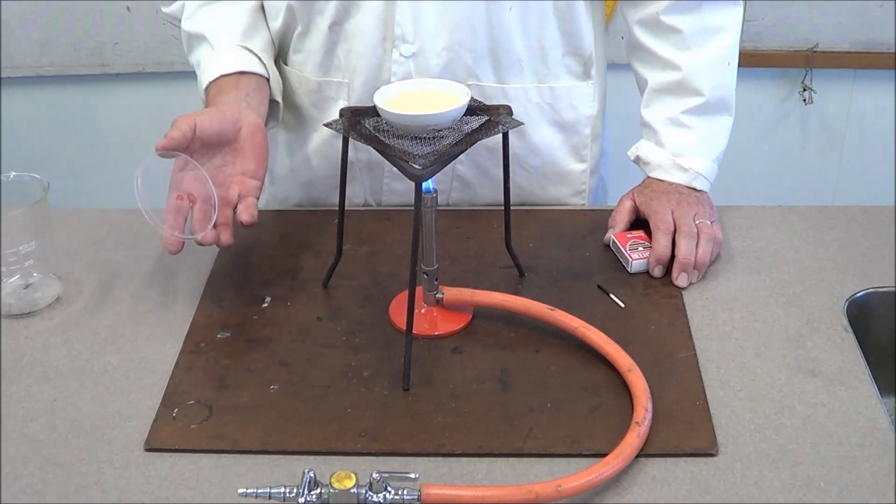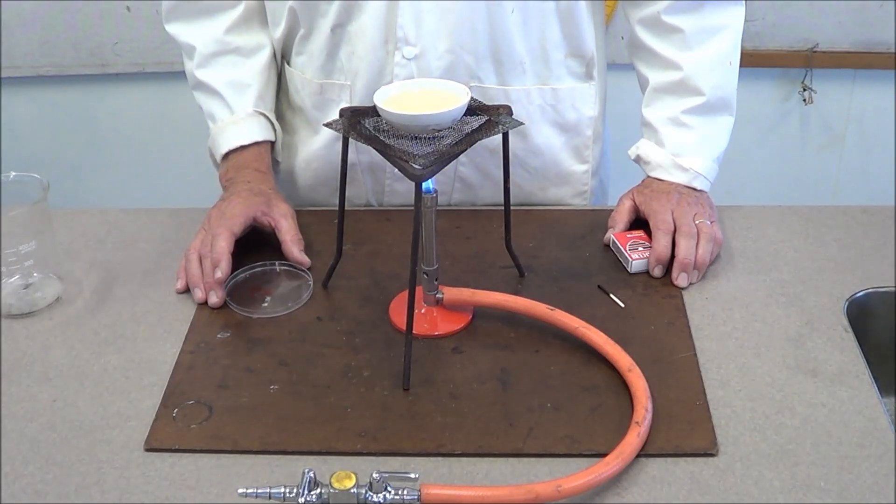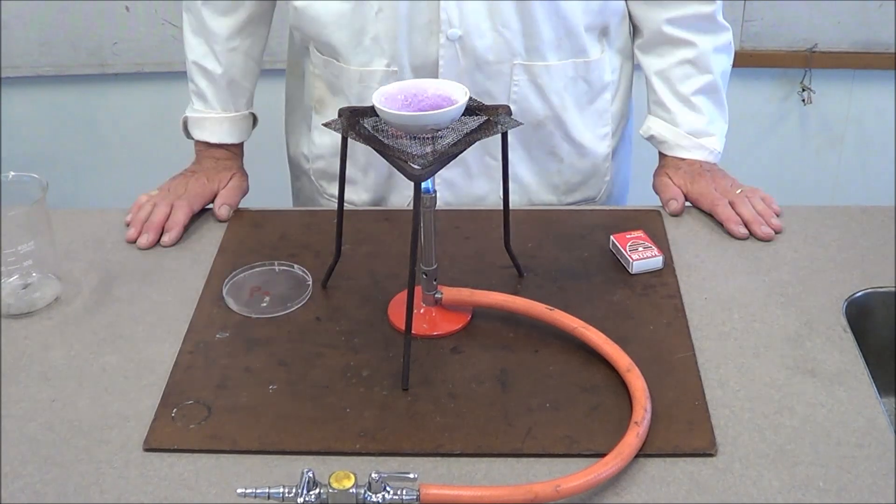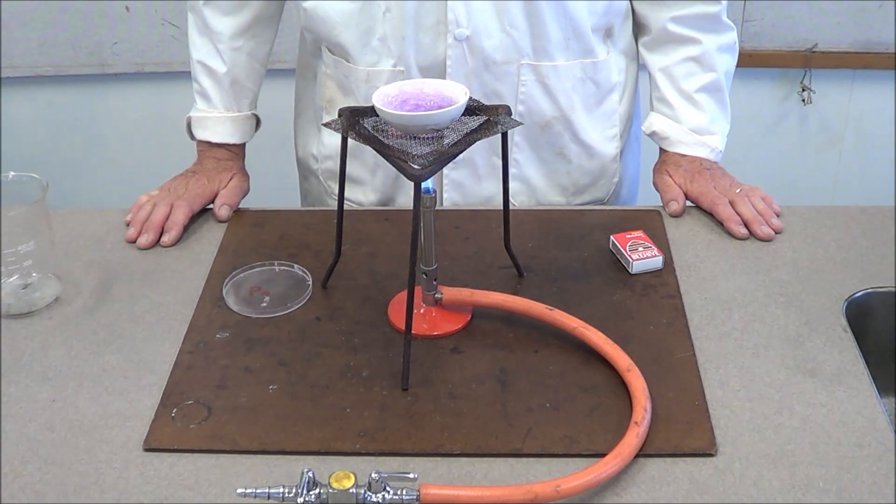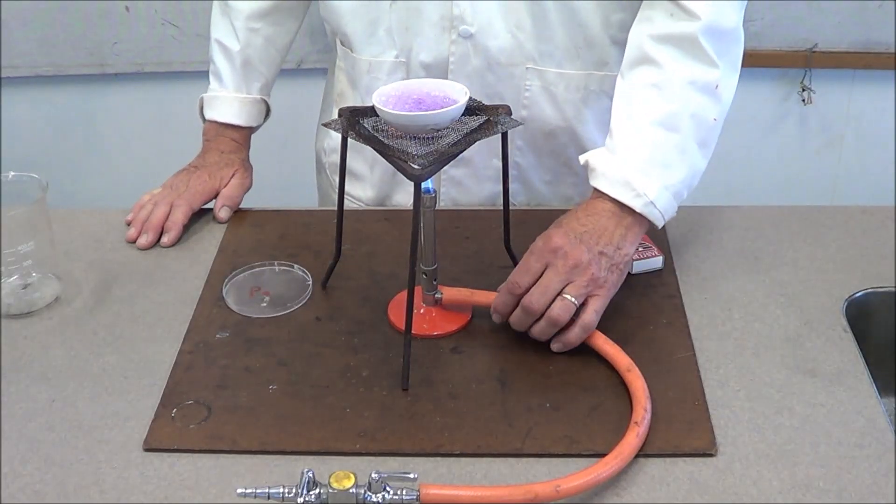Make sure it's labeled on the underside. This solution has now been boiling for a minute and a half. I can actually see the volume has gone down a little bit.